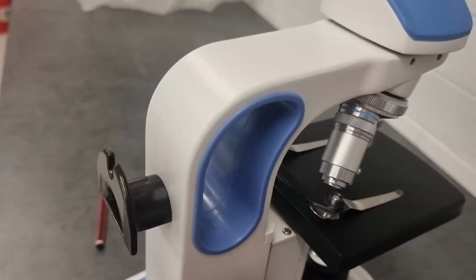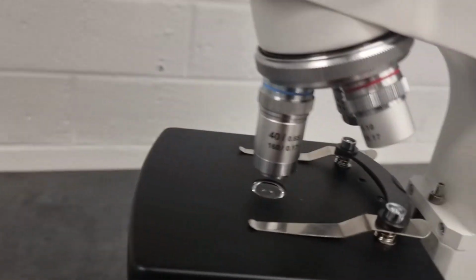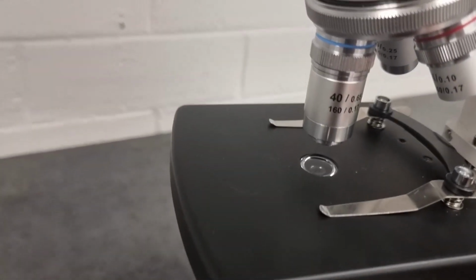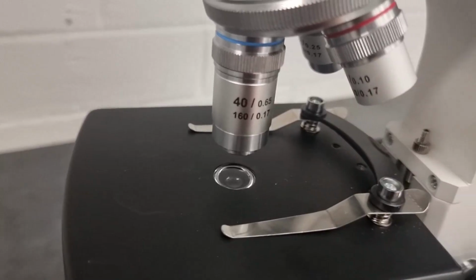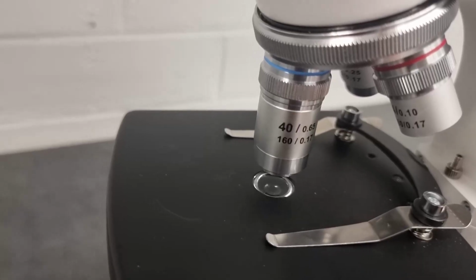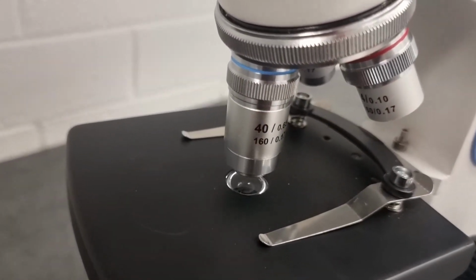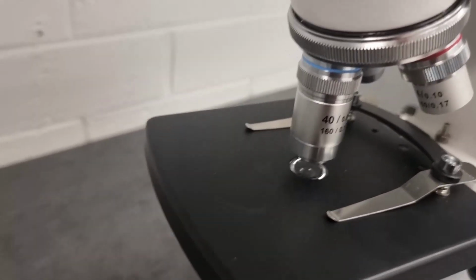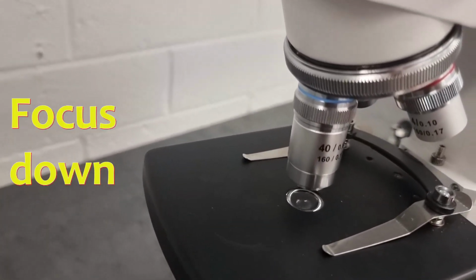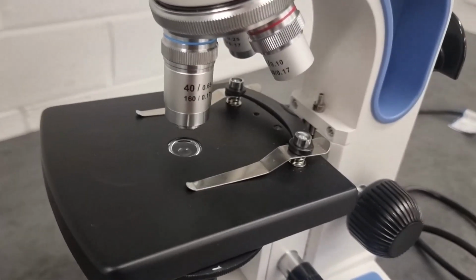Now, this is because what if you had a larger lens there? Let's move around to this side so we can see it more clearly. And the stage was down here. You put your slide on the stage, and then you start focusing, and you're moving the stage up. What can happen if you're not careful is that you move the stage up too close to that objective lens, and that smashes the glass slide that you have. That's not what we want. So you would put your slide on the stage first with the stage quite high, and then focus by moving the stage away from the objective lens. It's just a safety thing so we don't go breaking the glass slides.